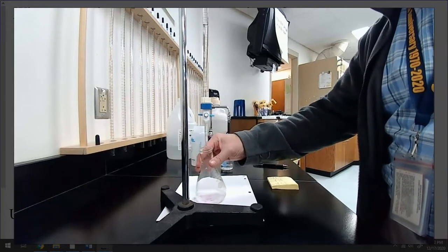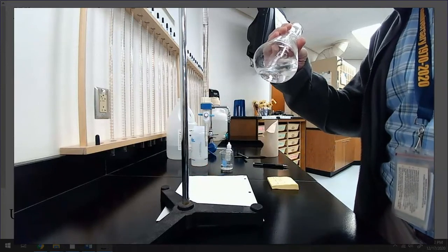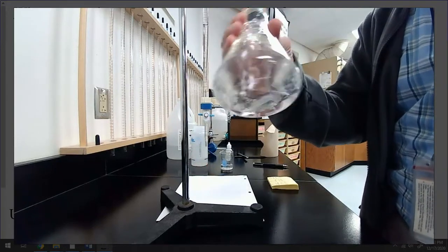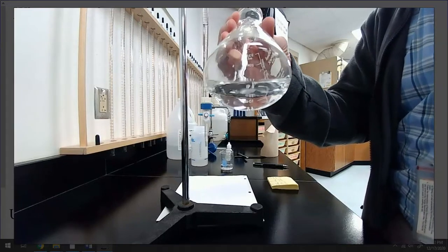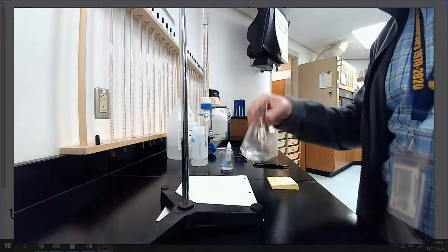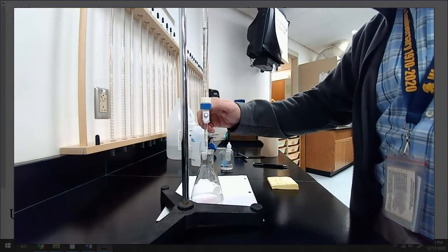V looks like it's a little more difficult to dissolve. A little bit larger crystals. You can't see it obviously on the computer screen, but maybe you can actually. Here, I'll try to get closer. Okay, if you can see the crystals in there, maybe you can't. I don't know. But a little bit larger crystals, so the dissolving of this one might be a little more tricky.